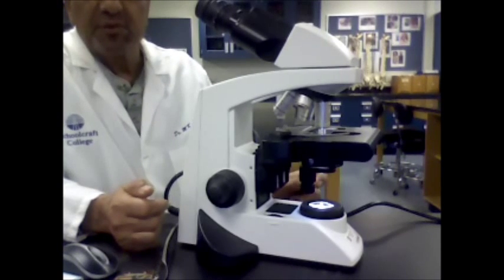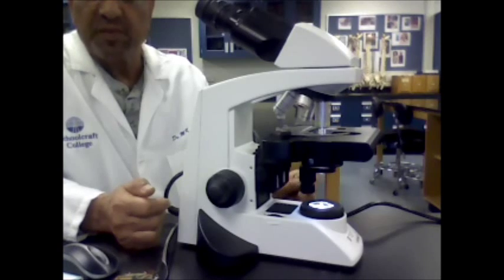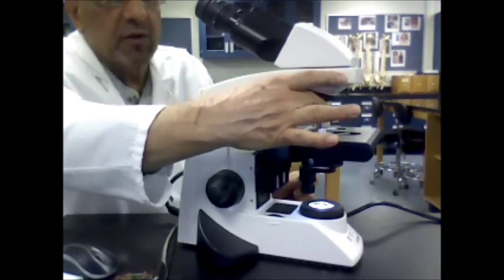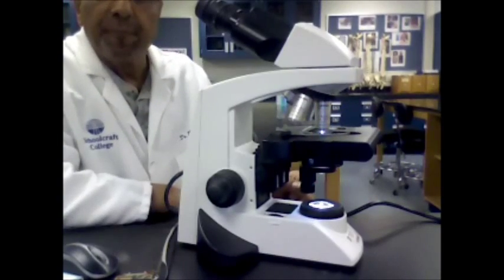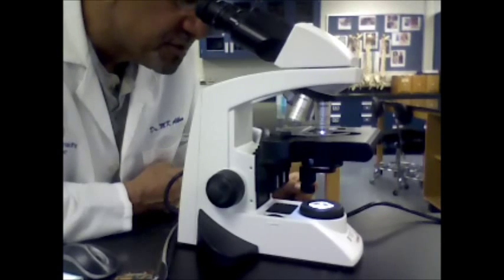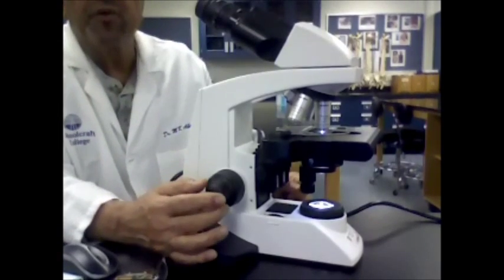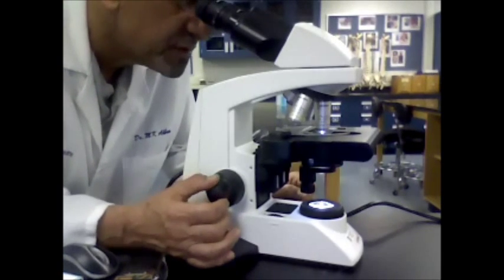Sometimes you will need to use the high power to examine the specimen for details. After you find it on the low power, you switch to the high power. It should be in focus because you already focused under the low power. If it's not in focus, with the high power you can only use the fine adjustment knob to focus.